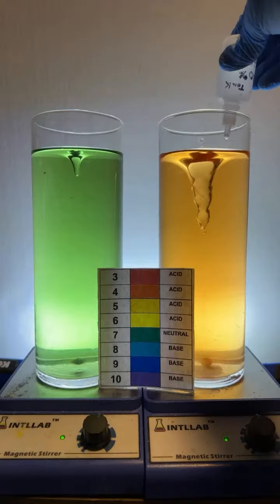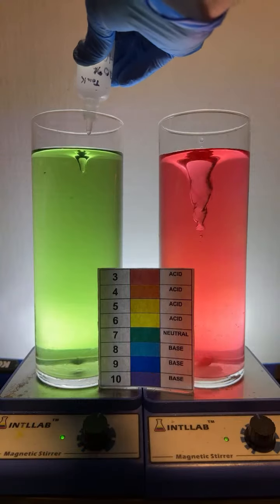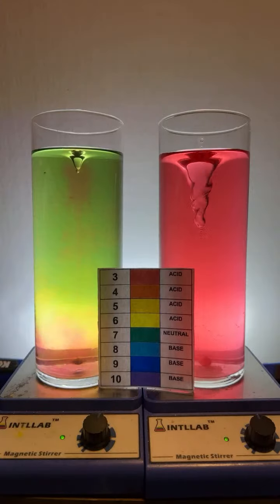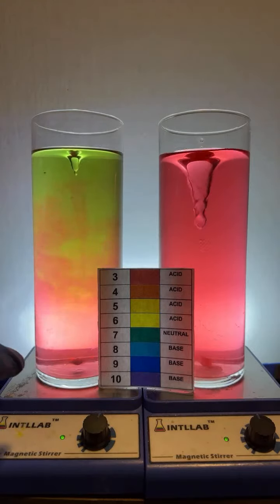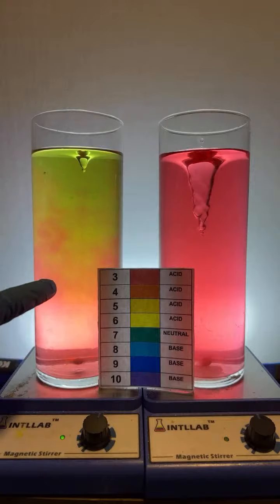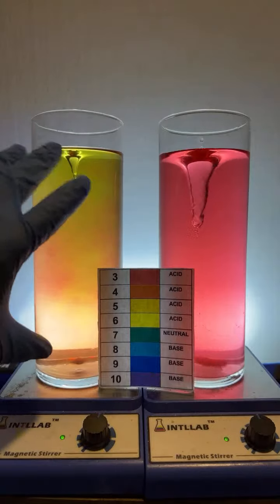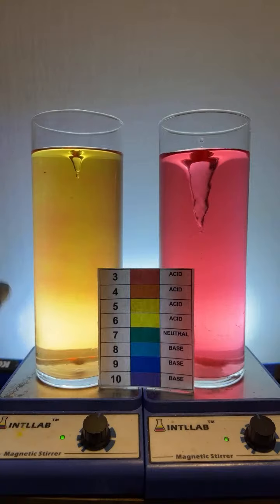Here we go. Let's add some acid over here on the left, and we're going to add drops of acid over here on the right as well. Check out what happens to the color. Look at those beautiful color changes occurring over here. You'll see at times a variety of colors in the solution, and what's going on is you have different regions of pH in the solution. As the acid and the base react with one another, you will get different regions with different pH until the solution homogenizes.